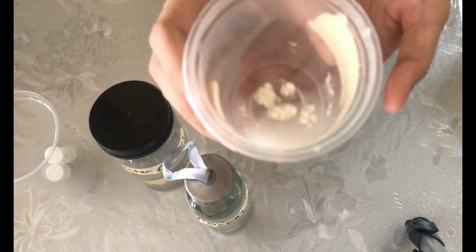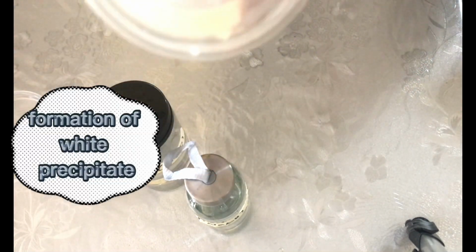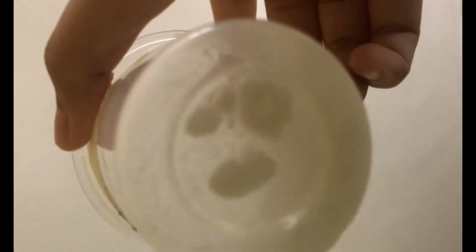After a few minutes, a white precipitate was formed. This means it is a sulfate. As we refer to the table chart, the ion for sulfate ion has a formation of white precipitate. So it is right that sulfate ions has contaminated high purity water.